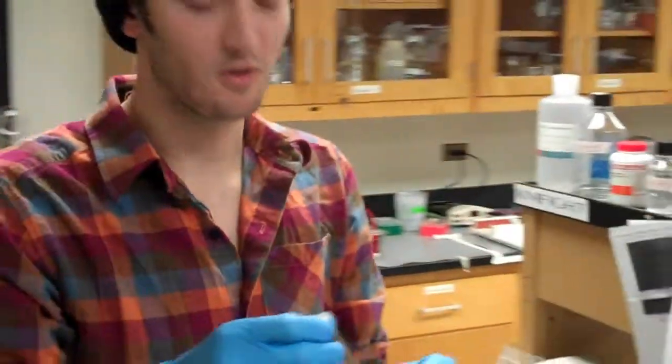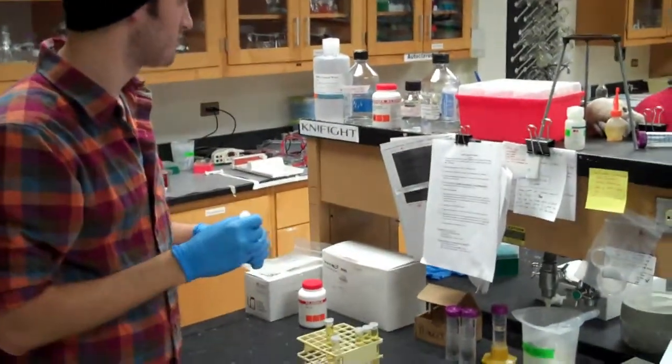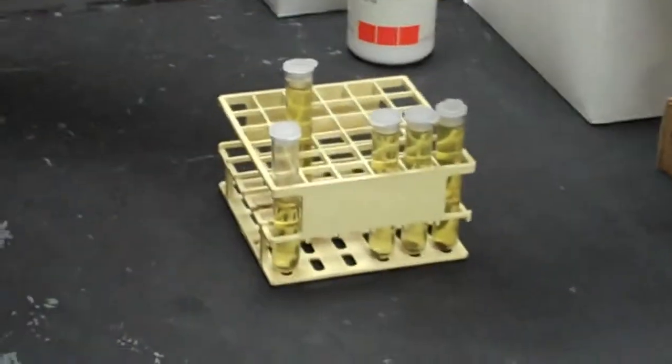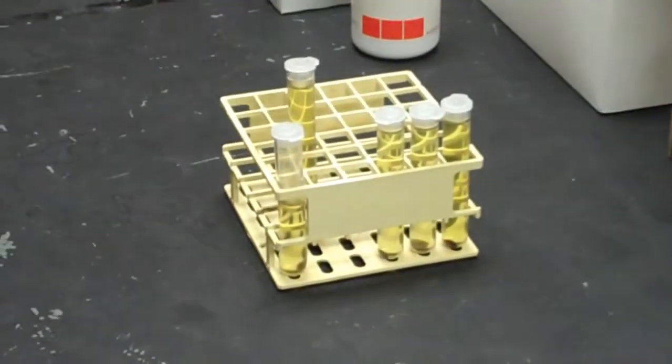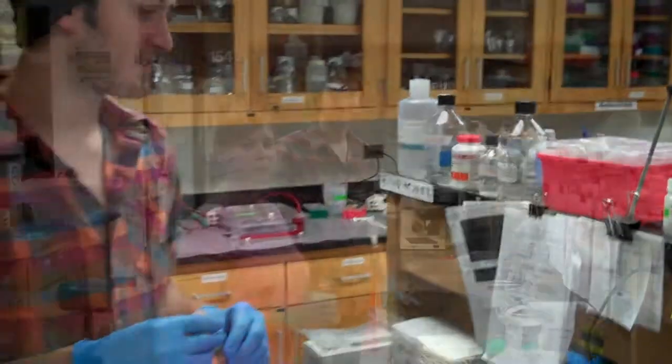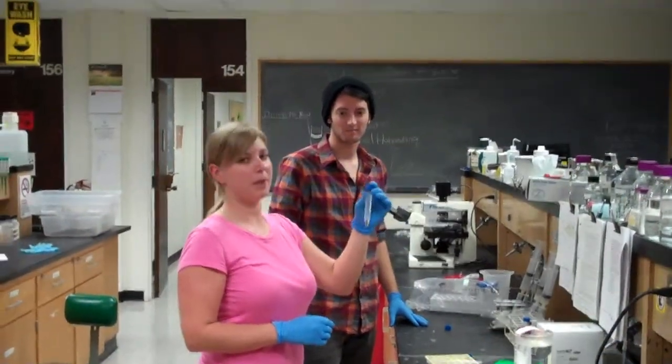We're going to collect them in one tube and dissolve in a solution that contains phosphate buffer, sodium deoxycholic acid, and Brij 52, which is this compound here, which is a waxy compound that you have to melt down. And that's the next step.